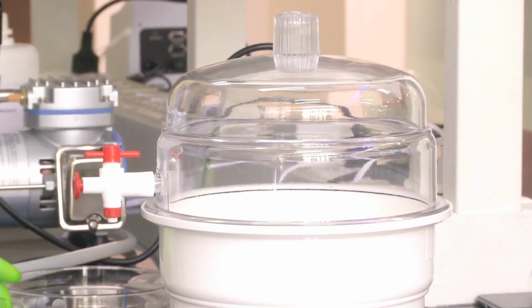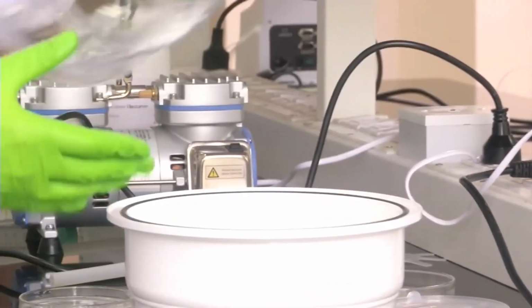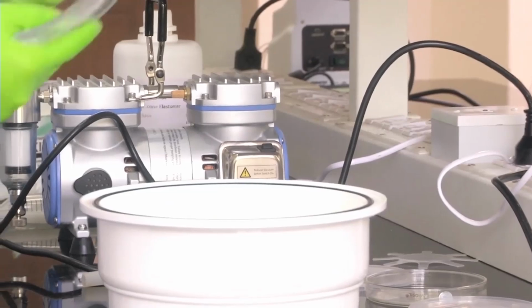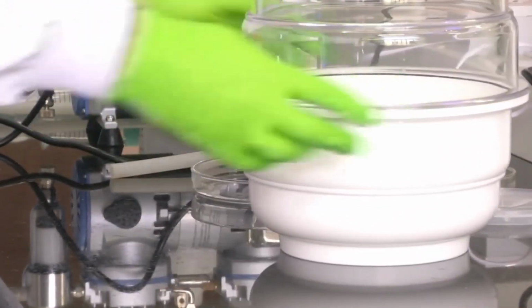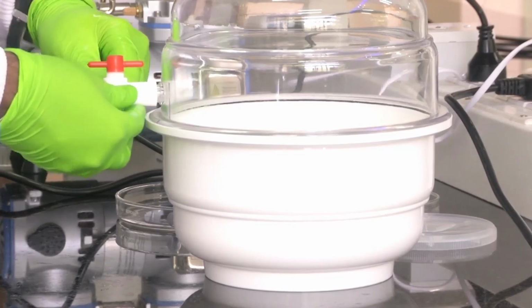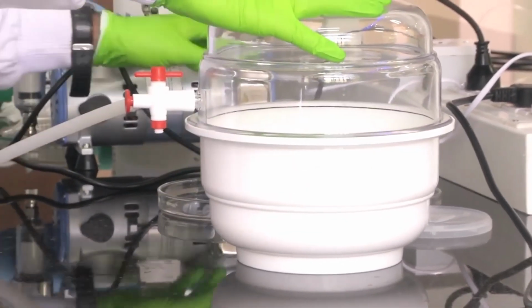What we will do now is we will keep this dish inside the desiccator. So I am opening the lid of the desiccator. Now we will keep this dish inside the desiccator. Okay, now we have kept the dish inside the desiccator. We are closing the lid. Now we will connect our vacuum pump to the inlet of the desiccator and now we will switch on our vacuum pump.